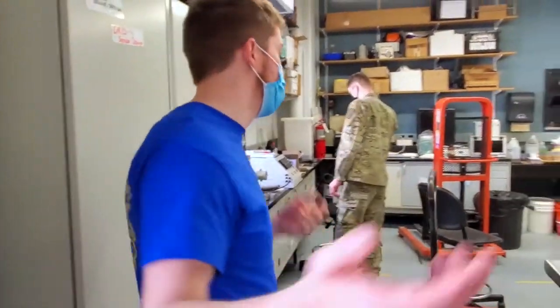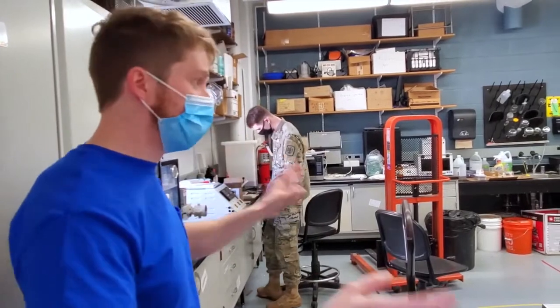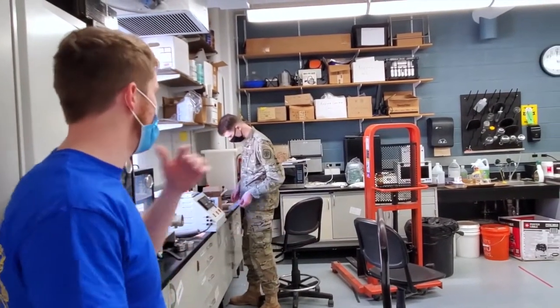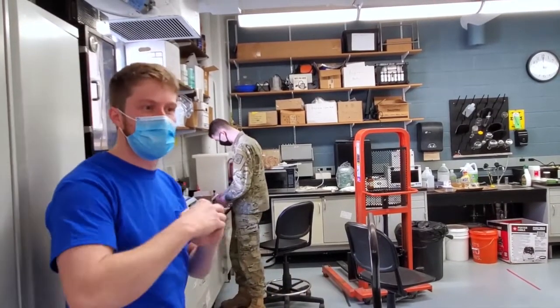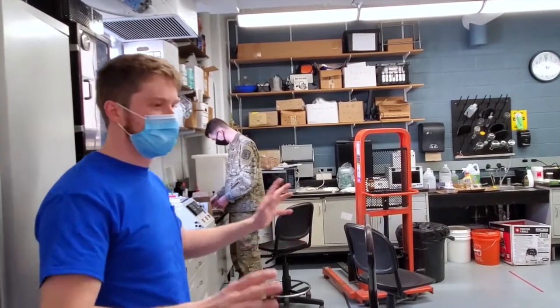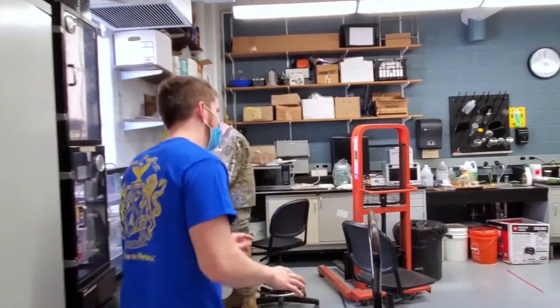Moving on, we're going into the microscopy and team project room. So people a lot of times doing senior design and undergraduate research, they'll store their projects here. So anytime you come through here, you've got to be careful because there's a lot of times a lot of people's different work is going to be at different stages and you don't want to mess anything up.